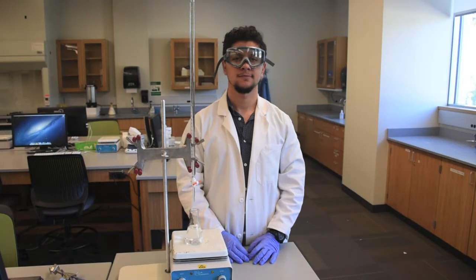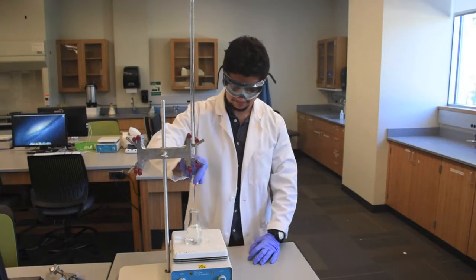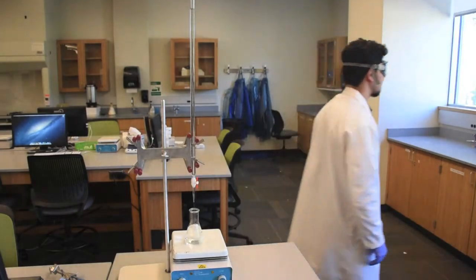We will outline the procedure from obtaining your burette to washing and measuring the initial volume inside it. We hope that this tutorial will help you out in lab. Now, sit back, relax, and let's get started.